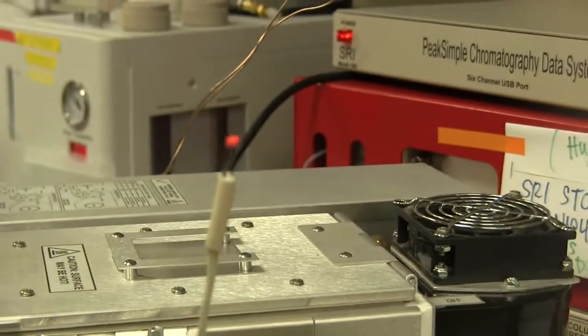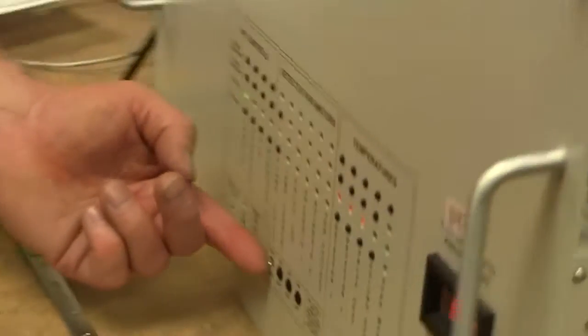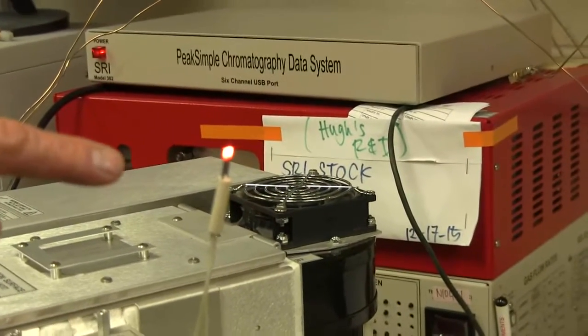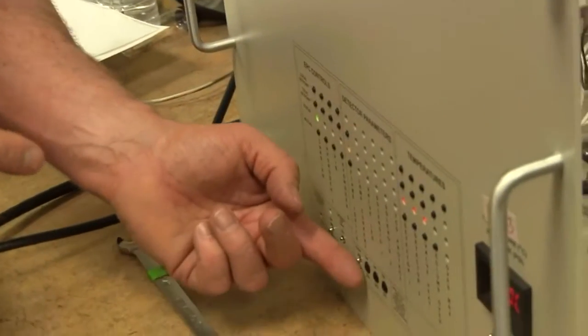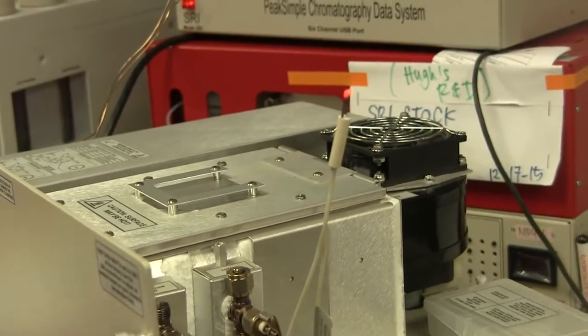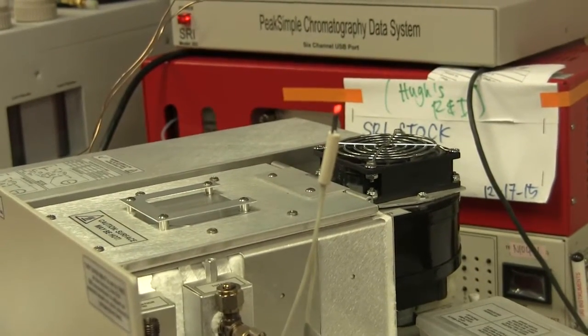Okay, so you can see the igniter is glowing kind of a dull red, and when I flip this switch on the front panel, the one that says flame ignite, you can see that the igniter actually gets a little brighter when I flip the switch. But we adjust this so that even when the switch is not activated, the igniter is always glowing this dull red, and that's what you look for down in the FID. If the flame's not lit, maybe it's because for some reason this igniter is not glowing like that. It should glow like that.